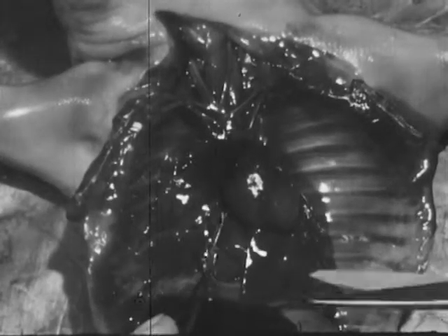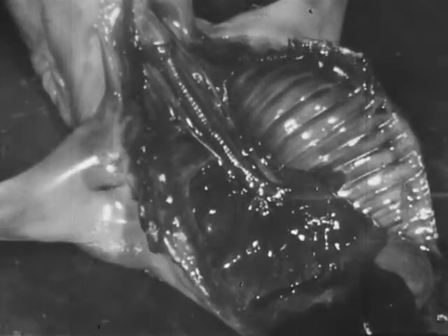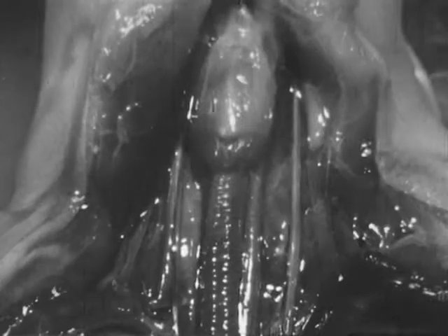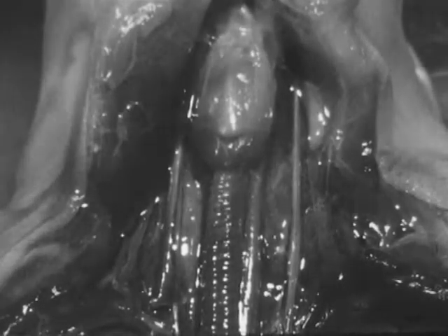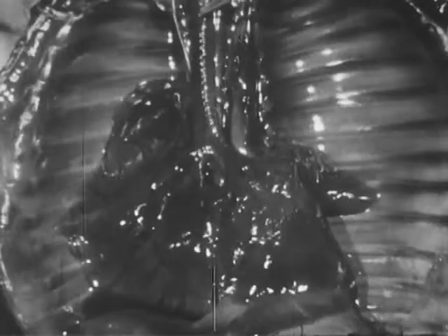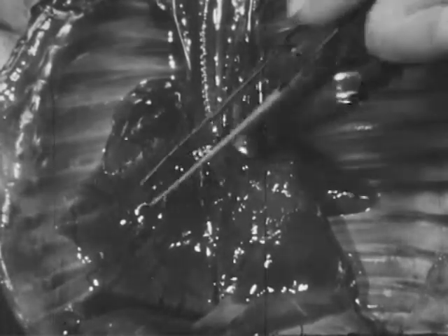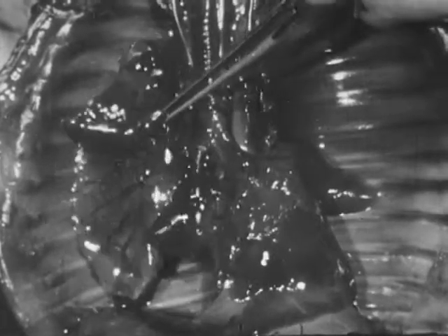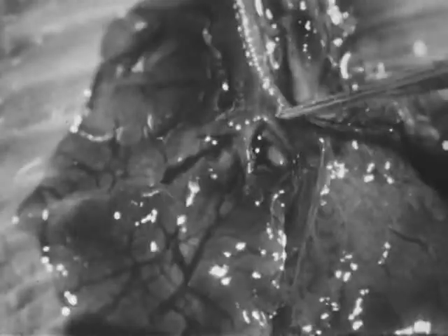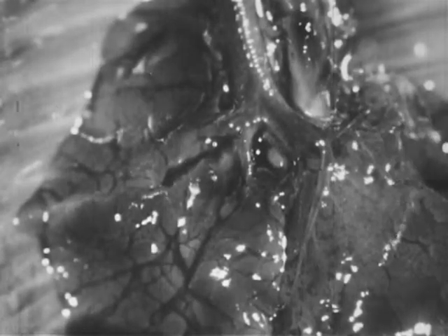Removing some of the blood vessels and the heart permits a clearer view of the respiratory system. After the mammal is born, air passes into the larynx, which contains the vocal cords, and continues through the flexible trachea, which is supported by rings of cartilage. The trachea branches into the two bronchi, which extend to the lungs. Each bronchus subdivides many times to form a branch work of small tubes. These tubes terminate in small bulbs, where exchange of gases with the blood occurs.